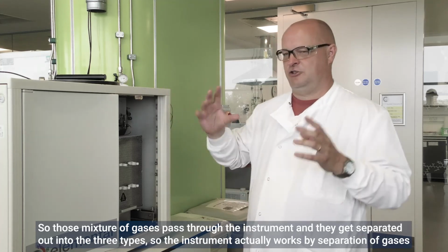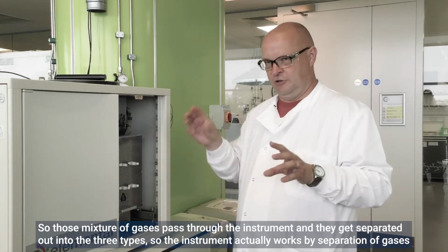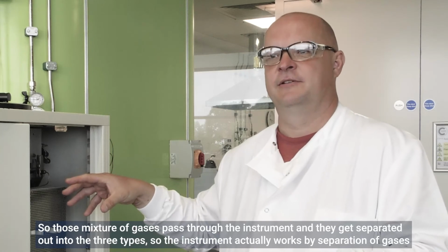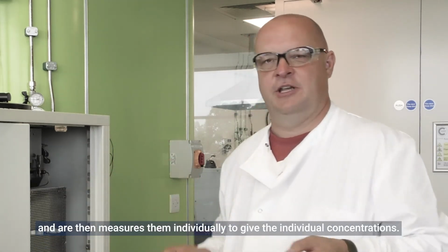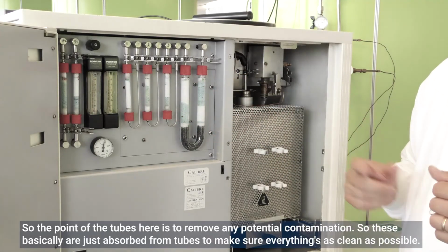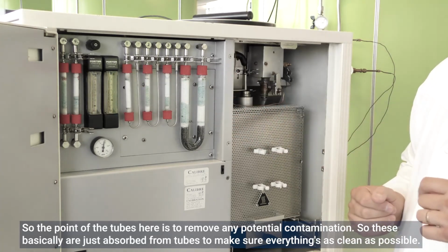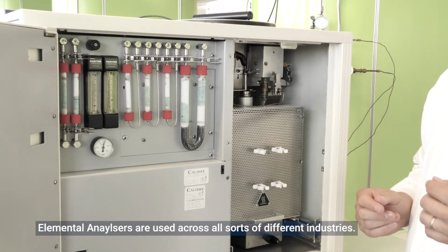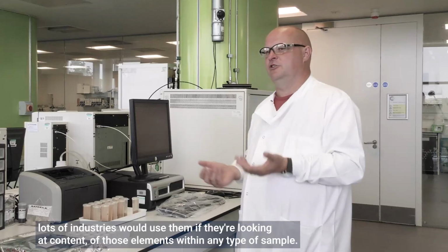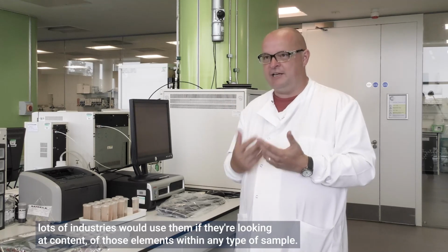So that mixture of gases passes through the instrument and gets separated out into the 3 types. So the instrument works by separation of gases, and it will then measure them individually to give the individual concentrations. The point of the tubes here is to remove any potential contamination. These are basically just absorption tubes to make sure everything is as clean as possible. Elemental analyzers are used across all sorts of different industries. Lots of industries would use them if they're looking at the content of those elements within any type of sample.